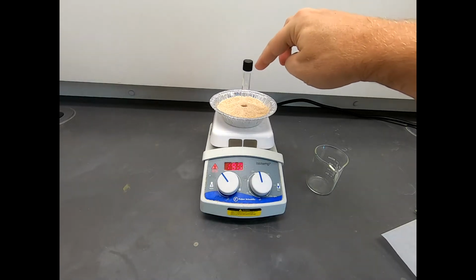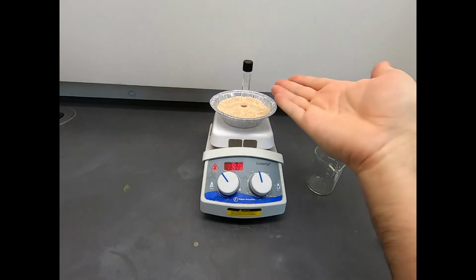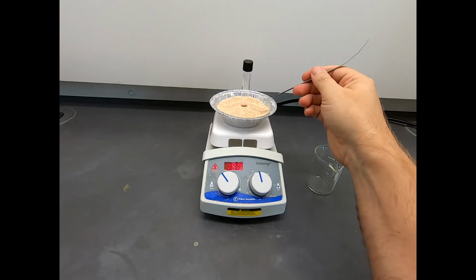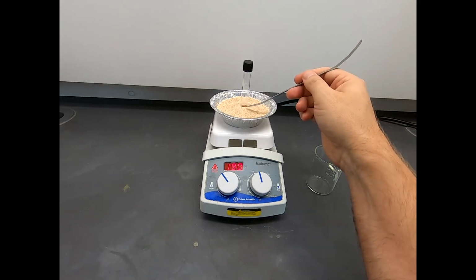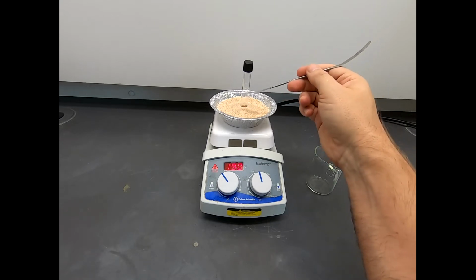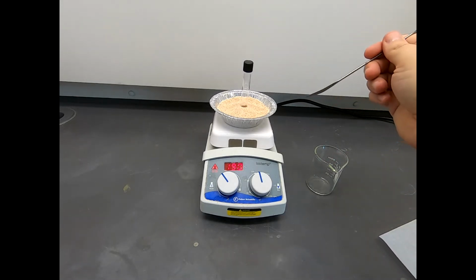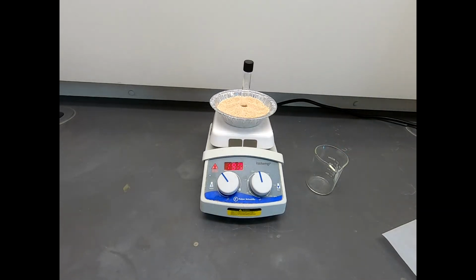Note that because the cap is not threaded, we can release pressure if we get gas formation and things expand in the tube. Also note that while it is very hot down here, this glassware is relatively cool. So if we do get any vapor, any boiling, it's going to come up to this cool glass and drip right back down. So it's almost a reflux setup in its own right, with kind of an air condenser at the top. But this will be adequate for this reaction. We'll let this go for 2 hours, and we'll come back when those 2 hours have elapsed.